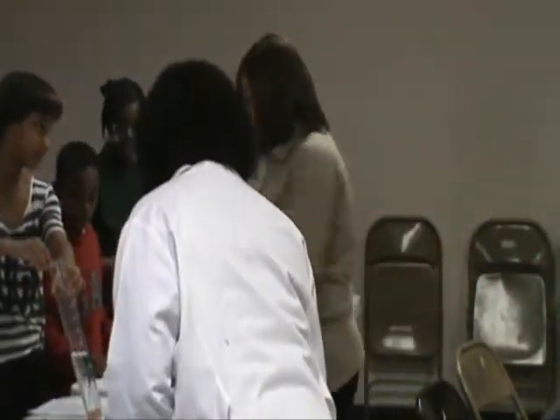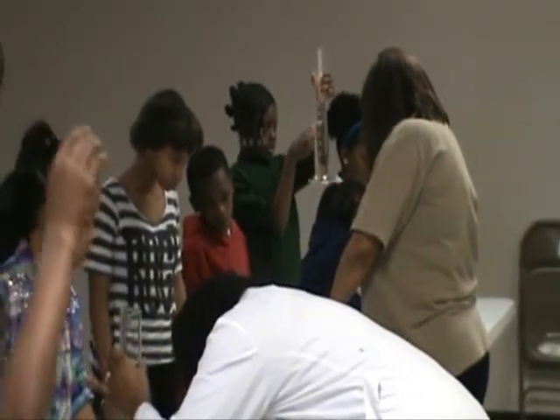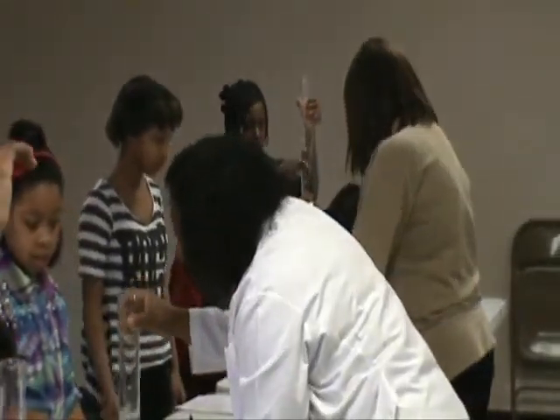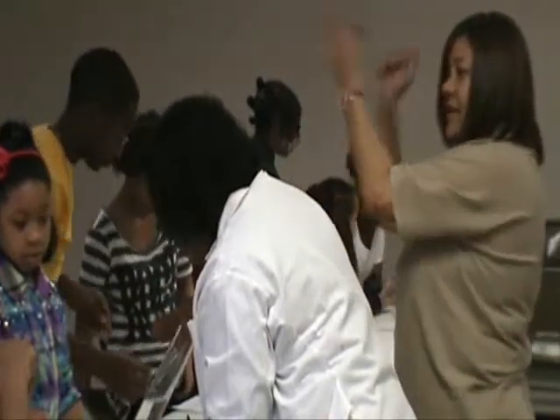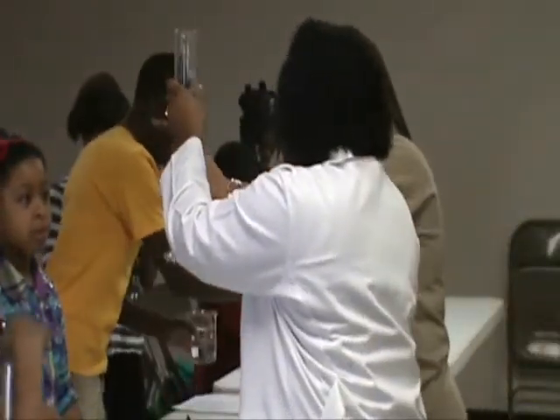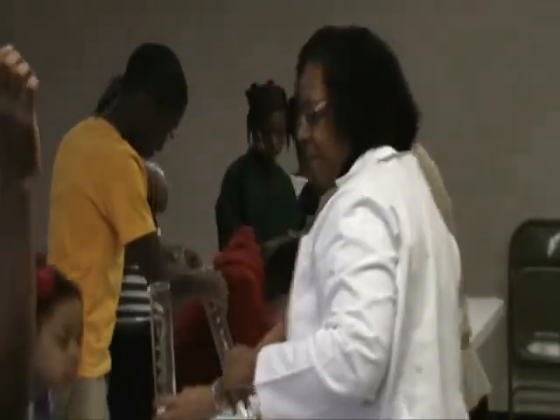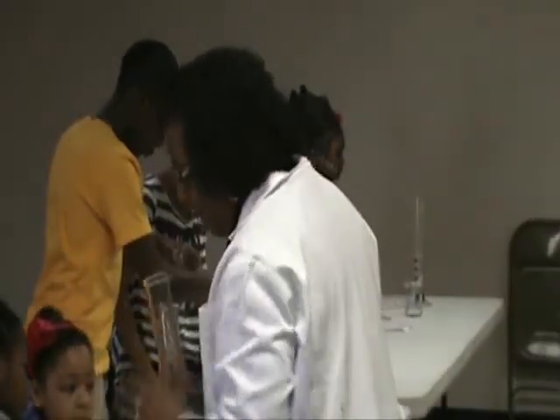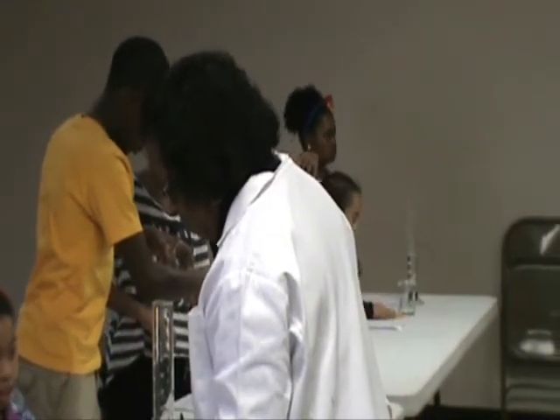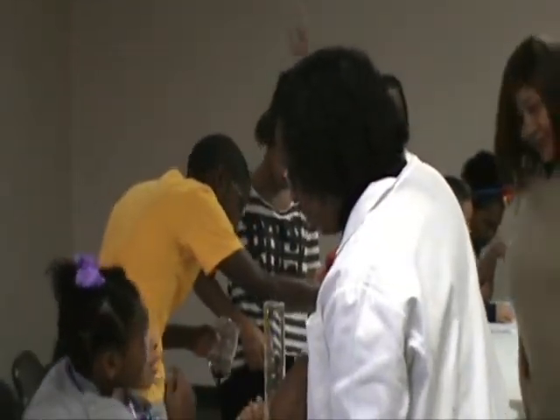Uh-oh. It's okay. When that happens, all you have to do is do this slow. Knock them like that, Barbara. It's okay. Just give it a little tap. There you go. Make the air bubbles go up. That's what it's supposed to do. What did it do? It pushed the water around, and it took up the space where the water was originally located.